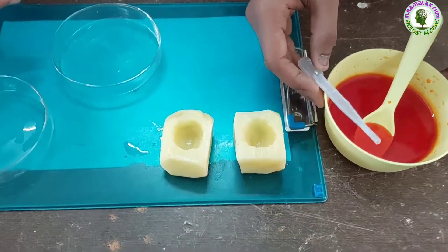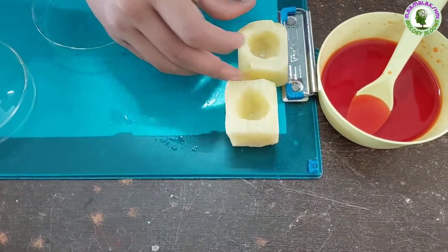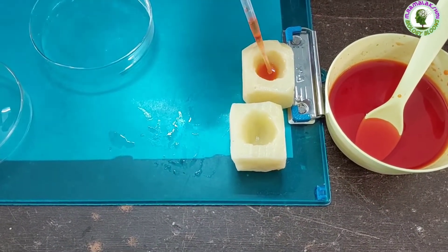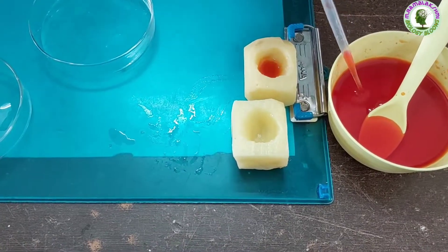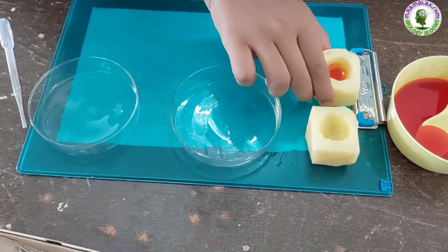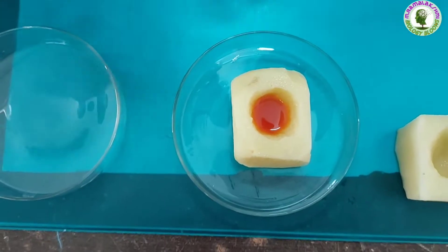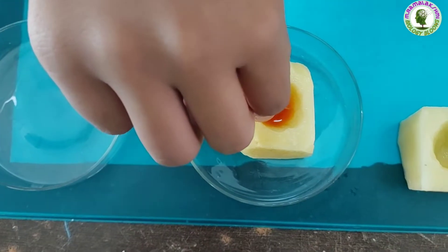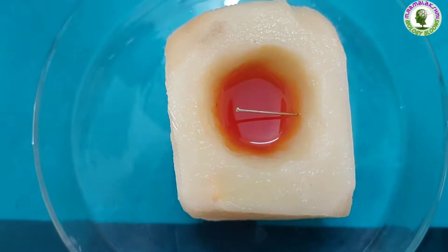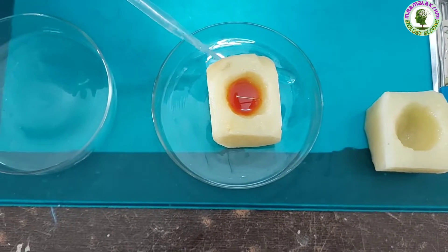Ramu, take some saturated sugar solution into one potato cup. Now keep it in a petri dish and mark the sugar solution level with a needle in the potato cup. Now pour some water into the petri dish.